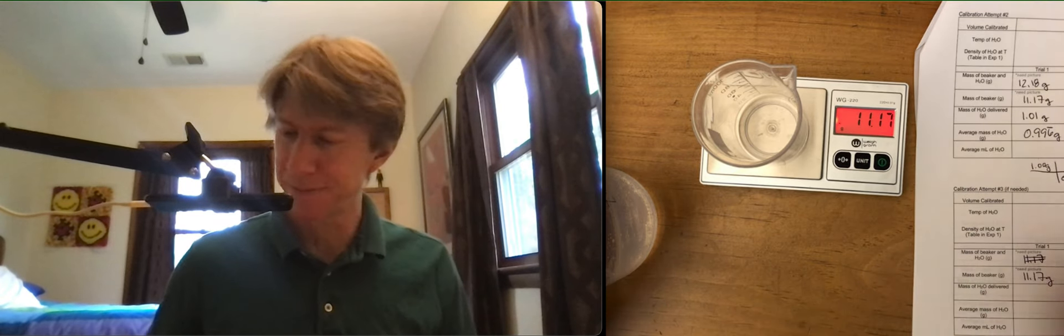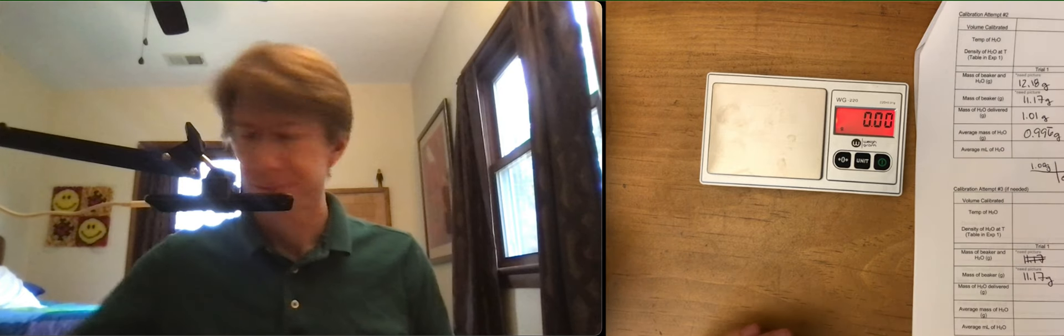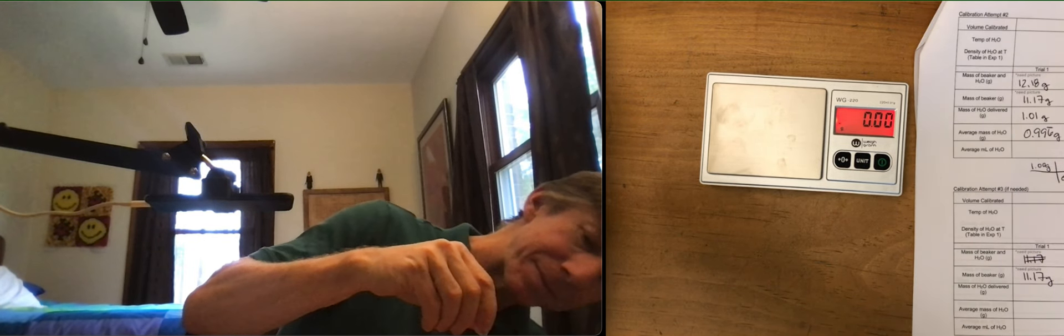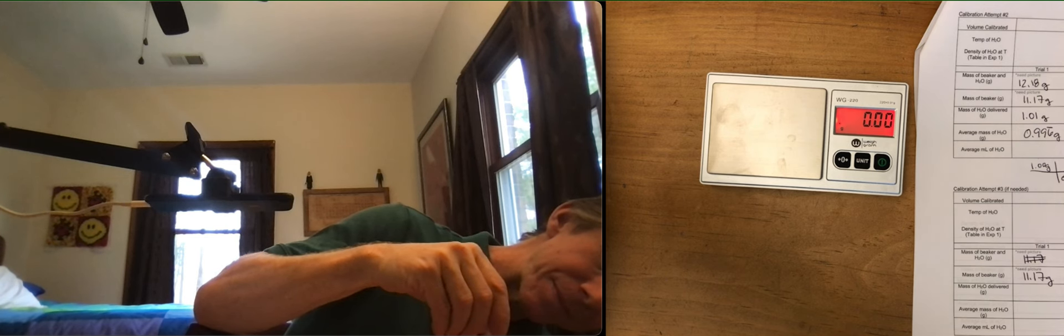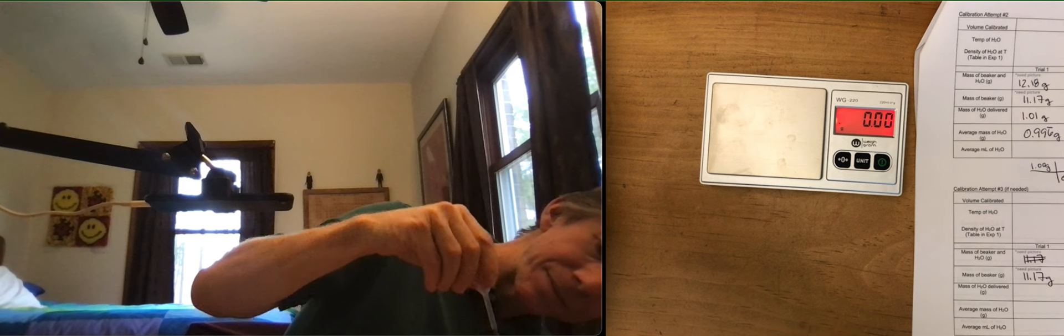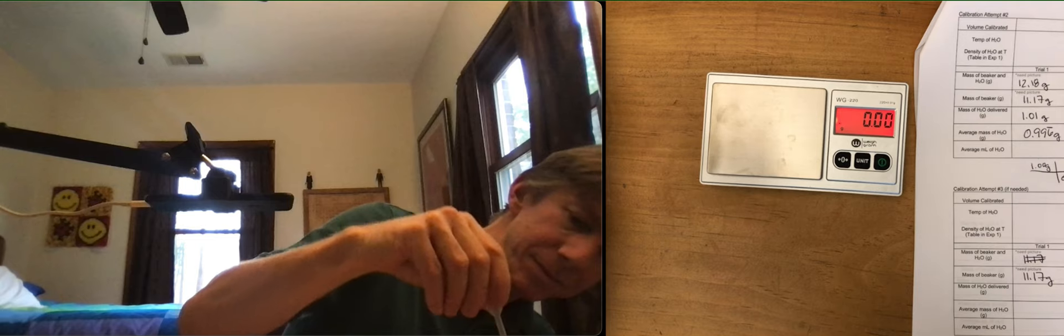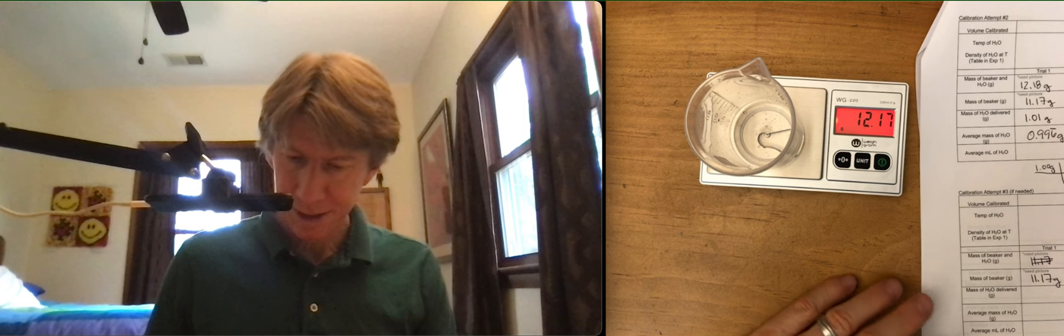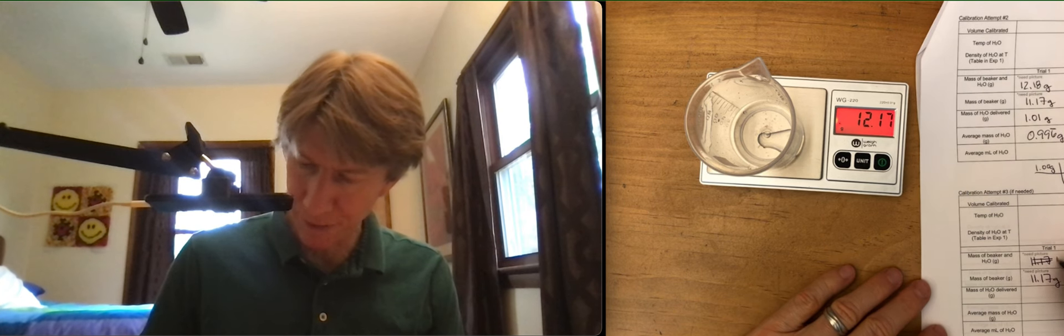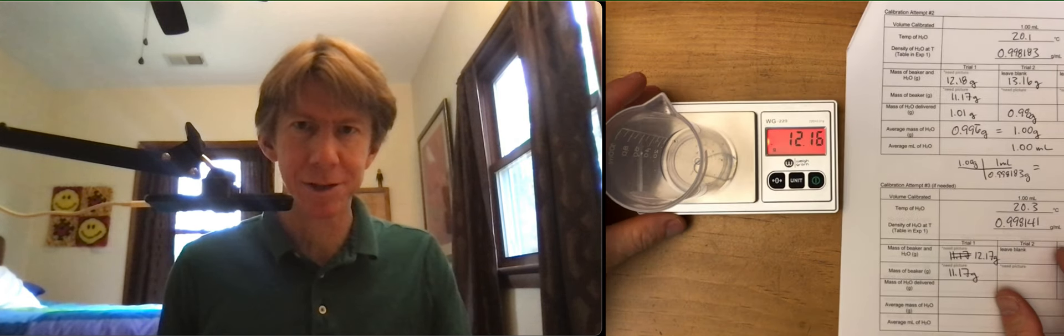Take it off. Go to that line again. Not quite. Boom. Boom. 12.17. That gives me exactly one gram so far. Snap. Take a picture.